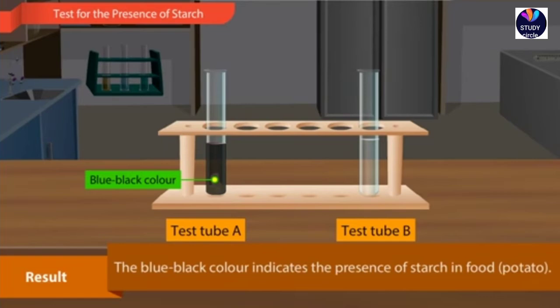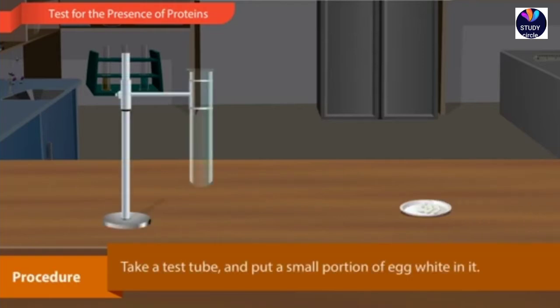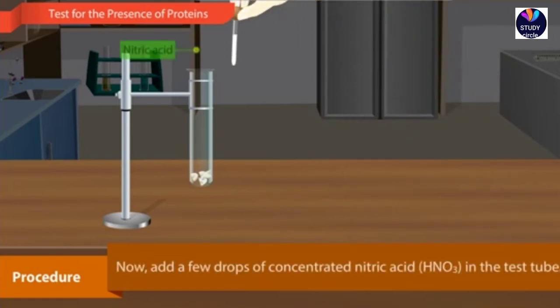Result. The blue-black color indicates the presence of starch in food, potato. Test for the presence of proteins. Procedure. Take a test tube and put a small portion of egg white in it. Now, add a few drops of concentrated nitric acid in the test tube.